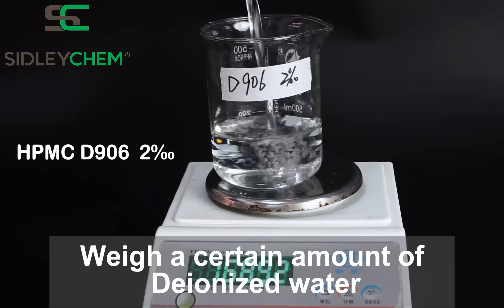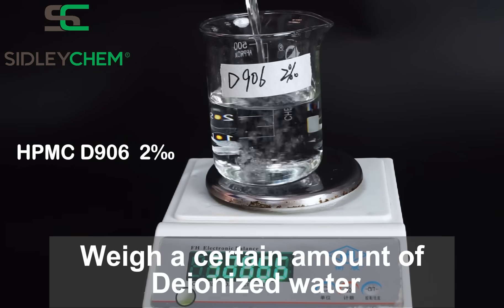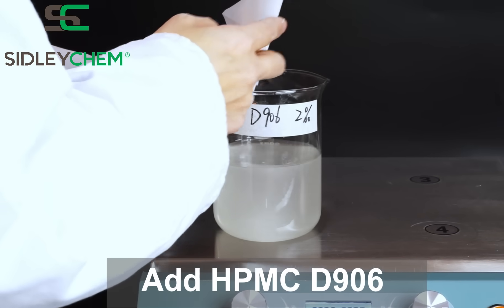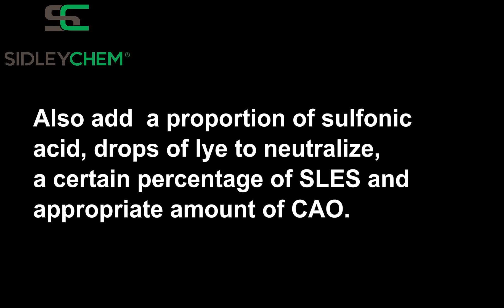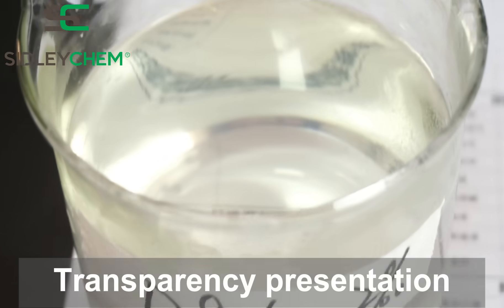Weigh a certain amount of deionized water and add HPMC D906, followed by a transparency presentation.